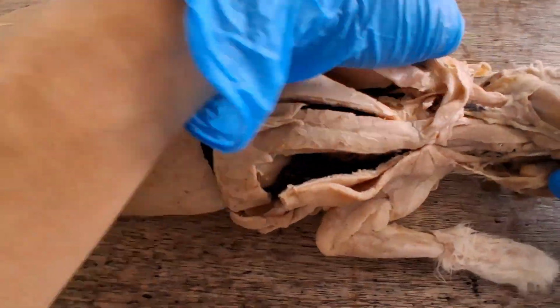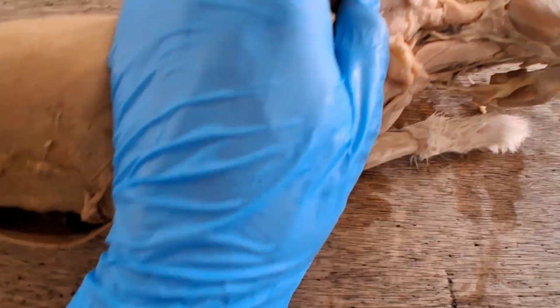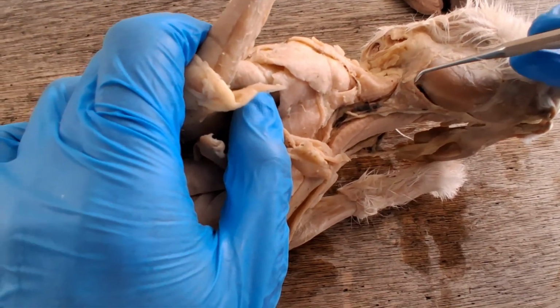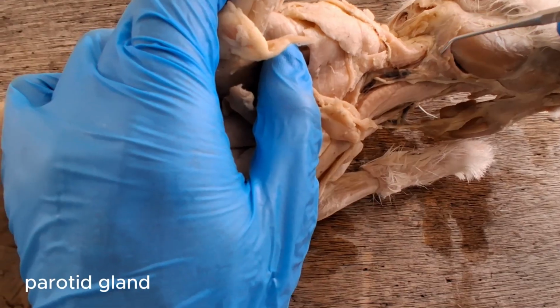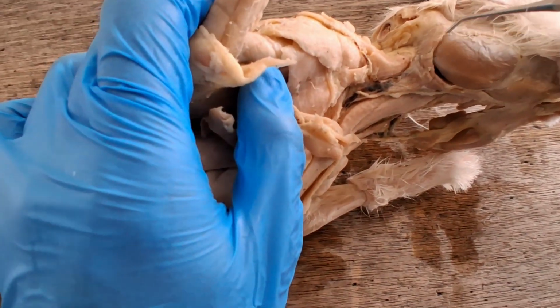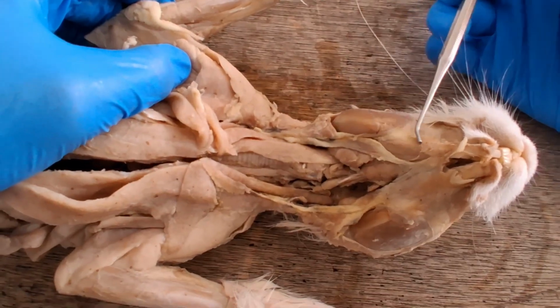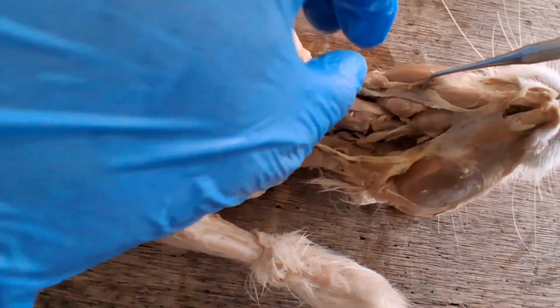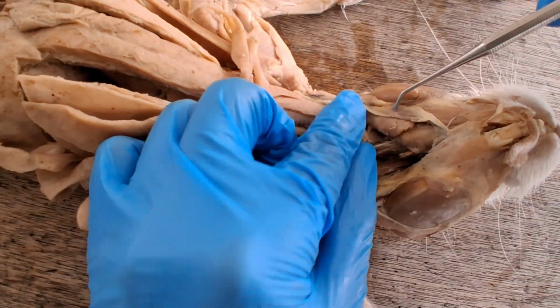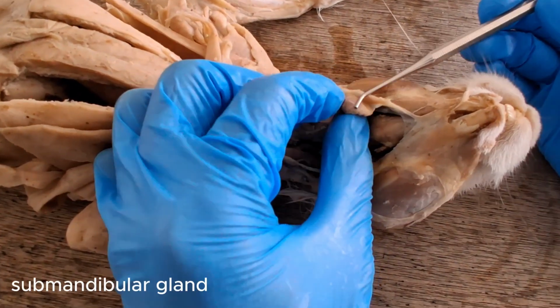So first would be the superficially exposed organs, the salivary glands, the largest of which is the parotid gland. This is the external jugular vein, so they're always associated with each other. And then below the jaws, so this would be the mandible, and running alongside the external jugular vein is another salivary gland. So that's the submandibular or submaxillary gland.